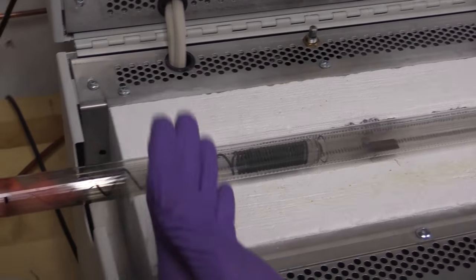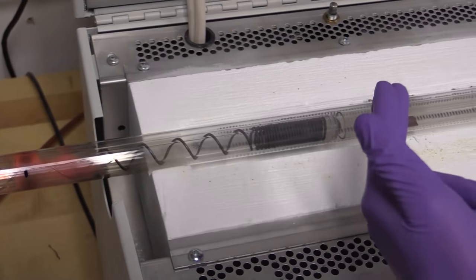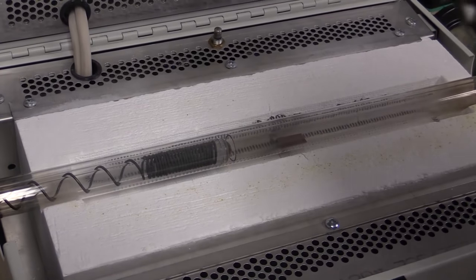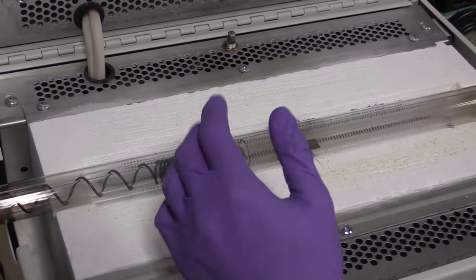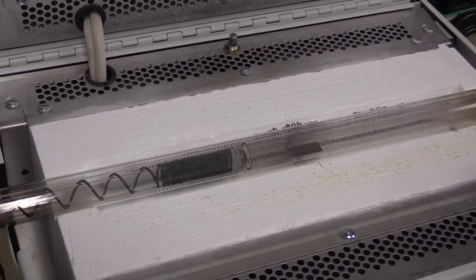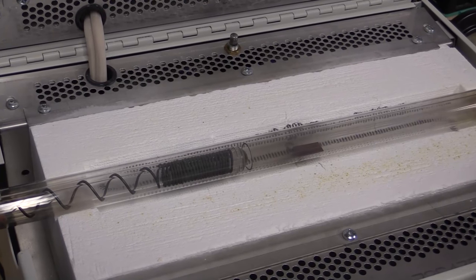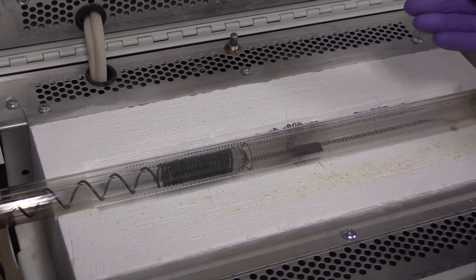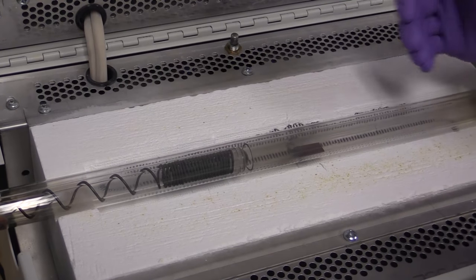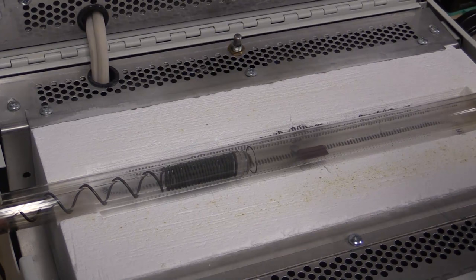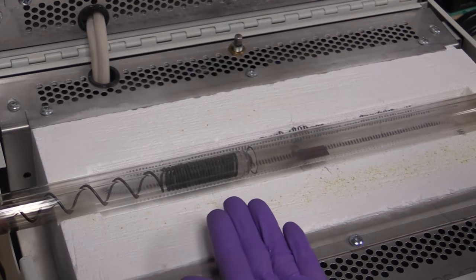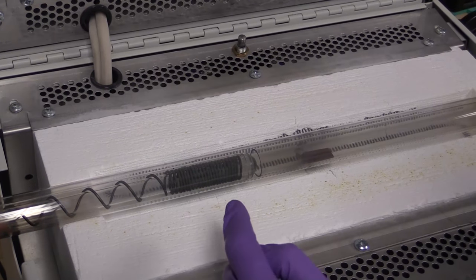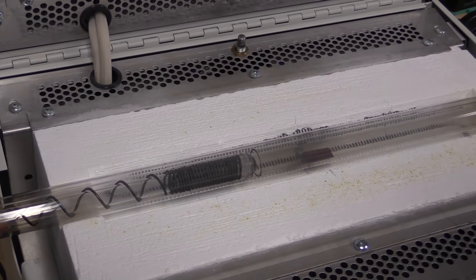So here we can see our heating coil, the inner tube, and the substrate. And if you pay close attention, the crucible is in there. The furnace will be put at 710 degrees. So the substrate is relatively far away, and it should be about that temperature quite uniformly. And here, about 4 centimeters away, we have the source and the heating element, which will be driven to about 950. Now we connect it to our gas line.